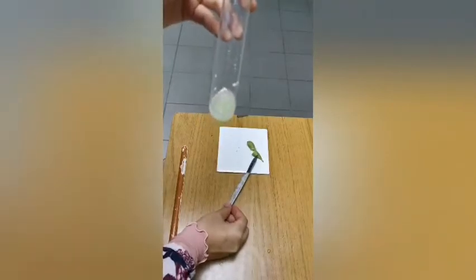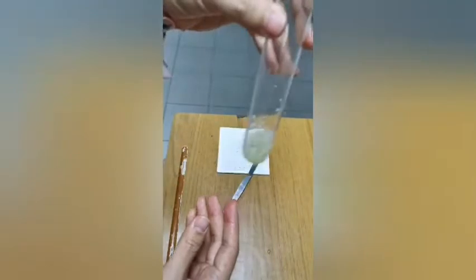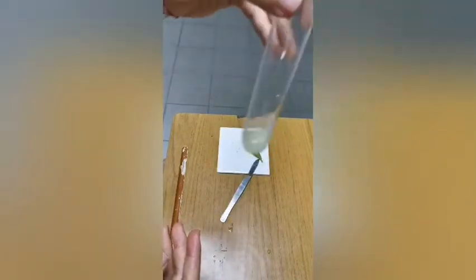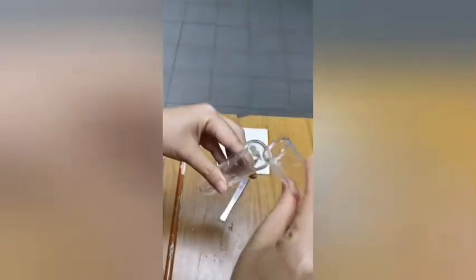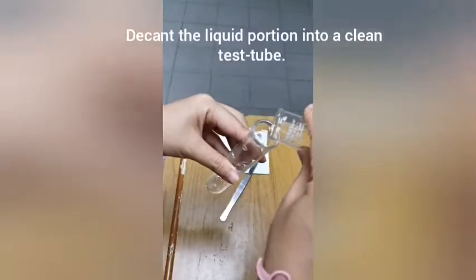Here I have some edamame beans that have been crushed up, and I have added 2 cm cube of water to the crushed beans inside a test tube, shaken it, and it has been sitting for about 5 minutes, enough time for the nutrients to dissolve into the water. Next I'm going to decant into a clean test tube, just pouring off the liquid portion.